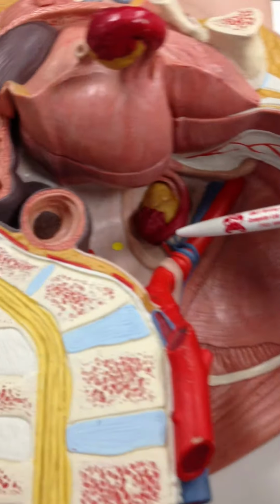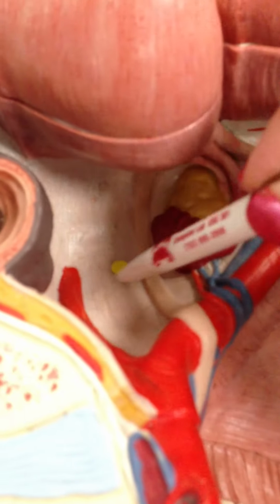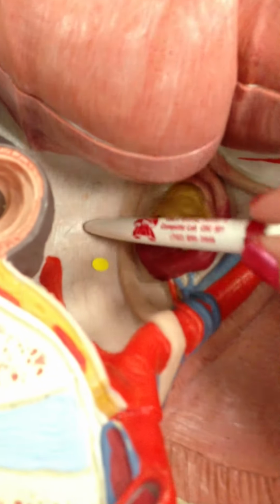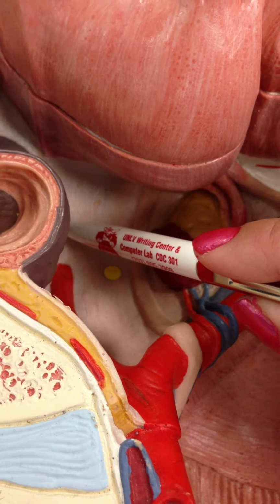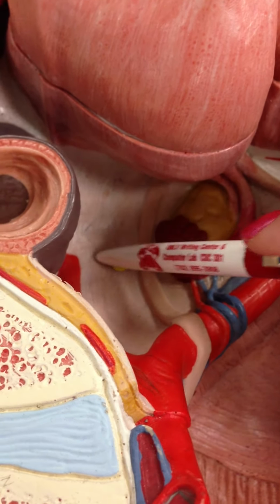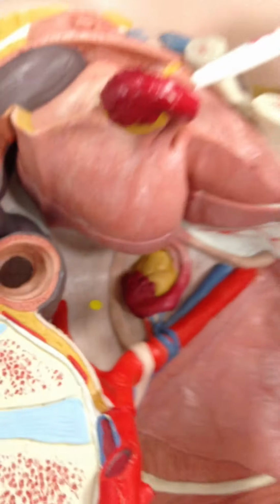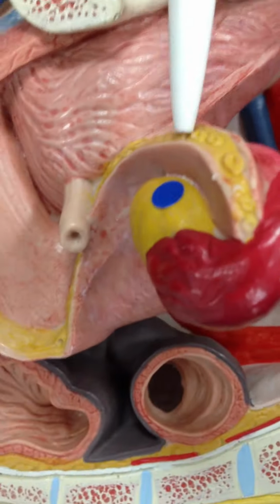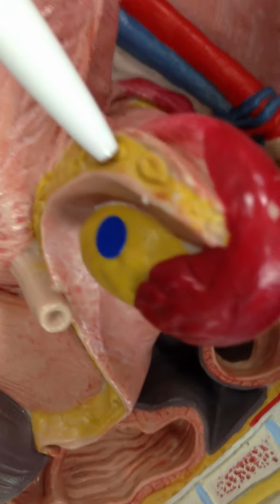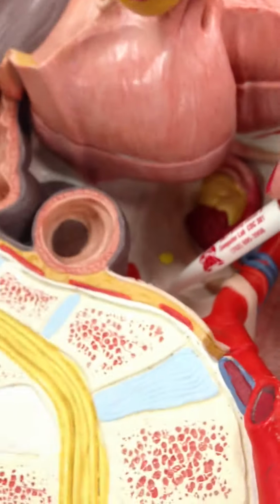But now, again, to stabilize the uterus to the body wall, we have this broad ligament here. It's broad because it's broad, and it stabilizes the uterus laterally. So broad ligament here, and remember it's symmetrical, so the broad ligament is also on this side, but it's truncated. Okay, so broad ligament here, broad ligament here.